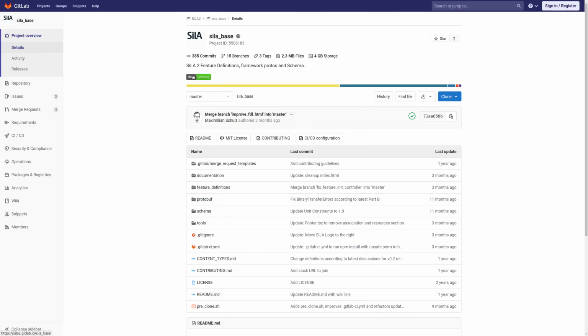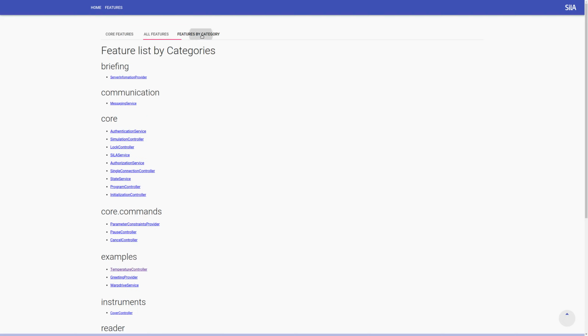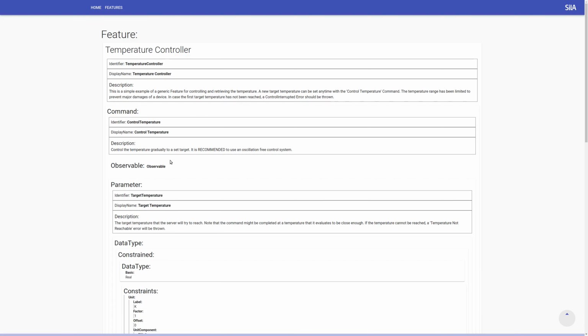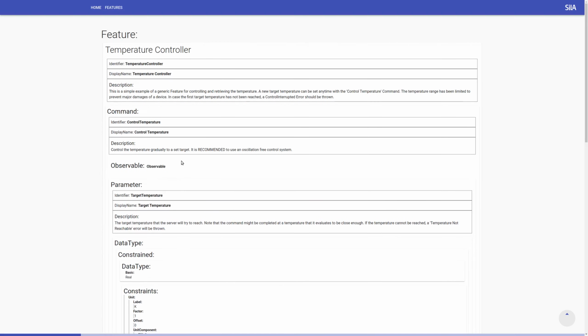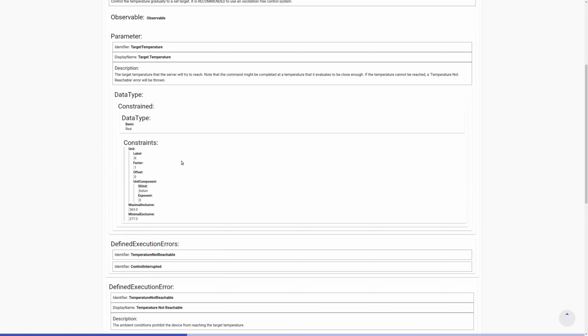Alternatively, you can browse our documents. So just go to this docs button, and then here on the top menu you see the core features and all features listed. Even features listed by categories. And then you should go through these features and see if something fits already. And you see there's already a feature called temperature controller. So that means that you can have a look at this feature and see if what was formulated here fits your needs, and if it fits, then you're set. Then you don't need to further develop that. Then you can just reuse it. So let's just say this is fine for us. Then let's look if there's also a shaking feature.